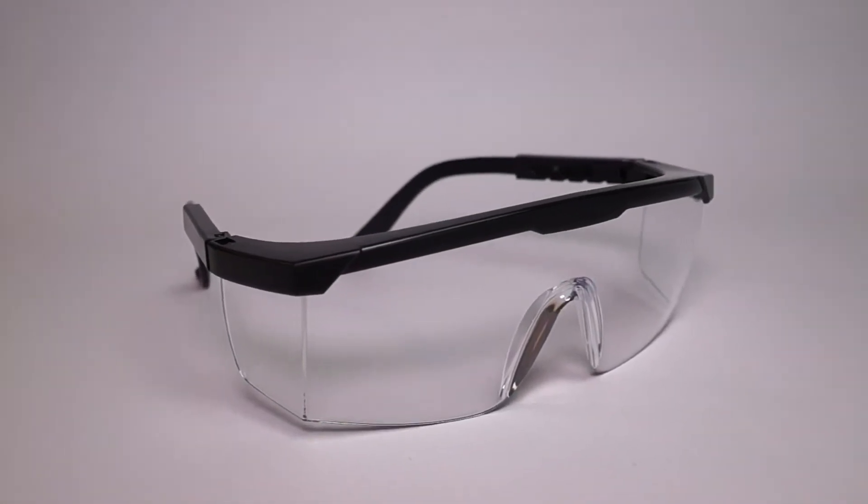Do not forget to put on protective gloves and eye protection, and perform all the experiments on a plastic tray.